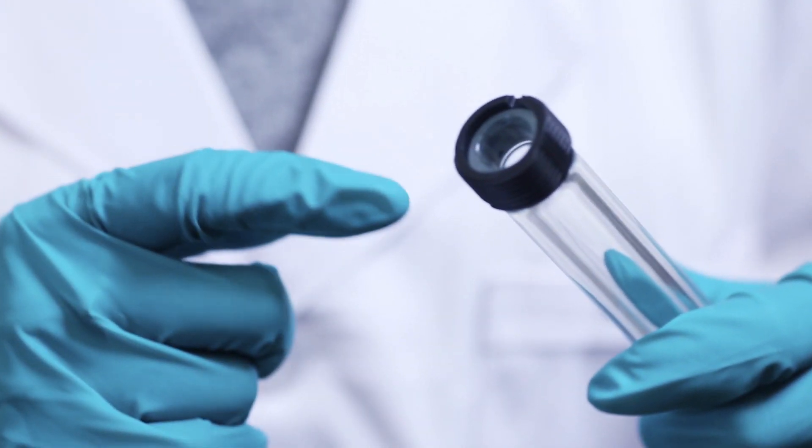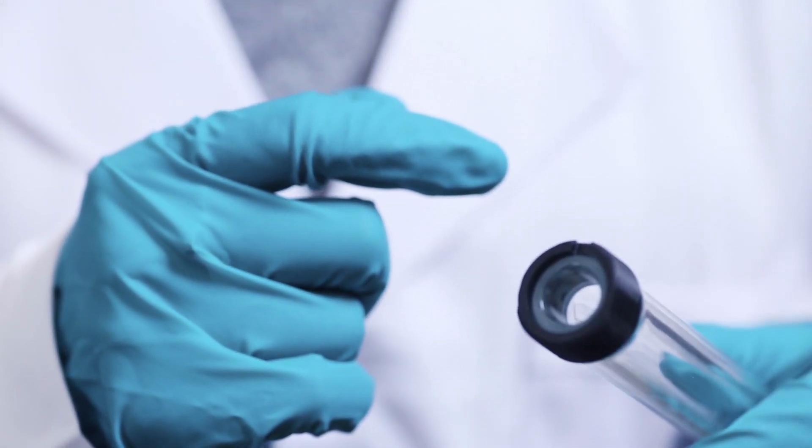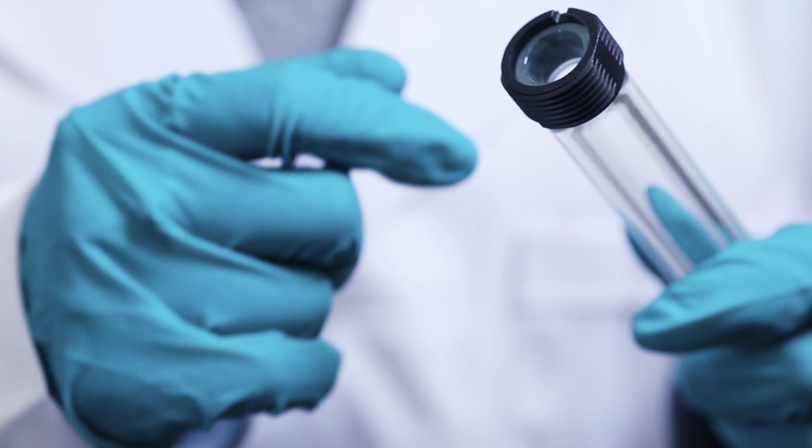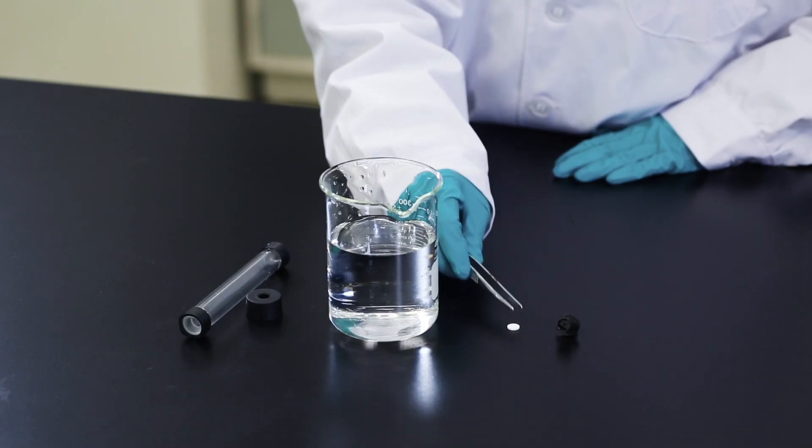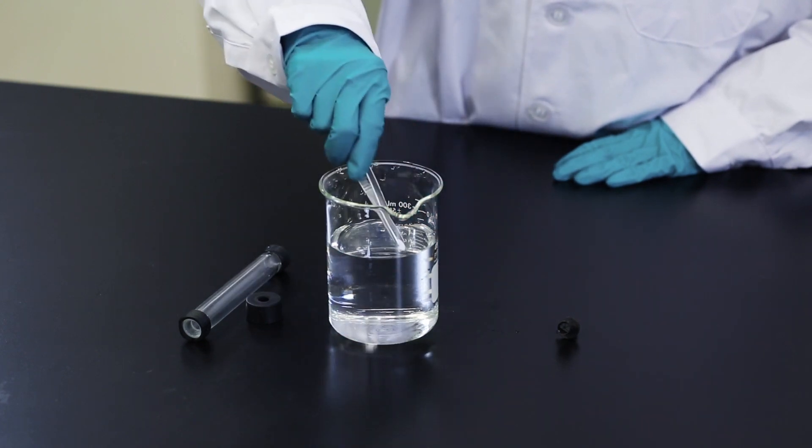All column components must be in perfect condition. Inspect the glass components paying particular attention to the ends. Columns with chipped ends should be replaced.